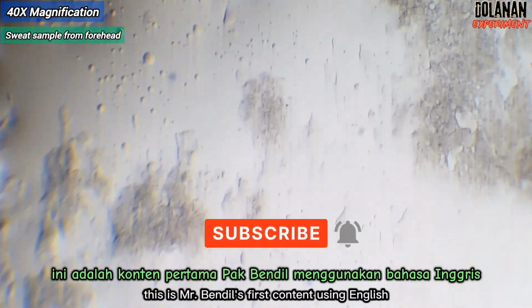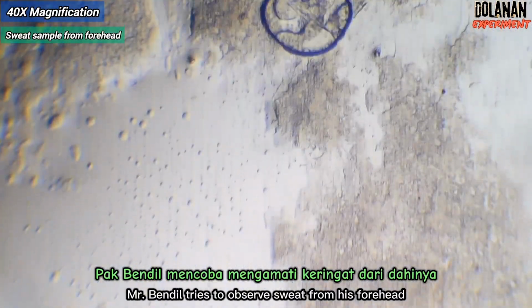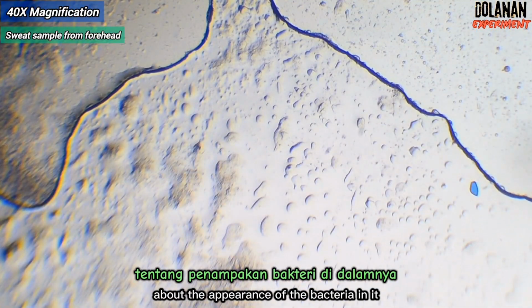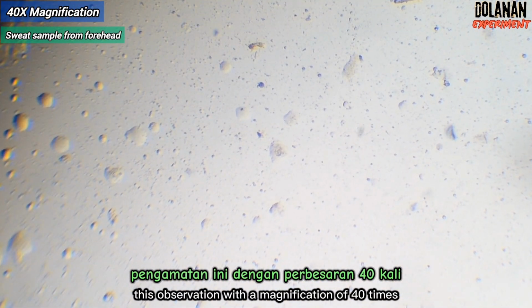Hello friends, this is Mr. Bendel's first content using English. In this video, Mr. Bendel tries to observe sweat from his forehead with a microscope. He is curious about the appearance of the bacteria in it. As usual, Mr. Bendel begins this observation with a magnification of 40 times.